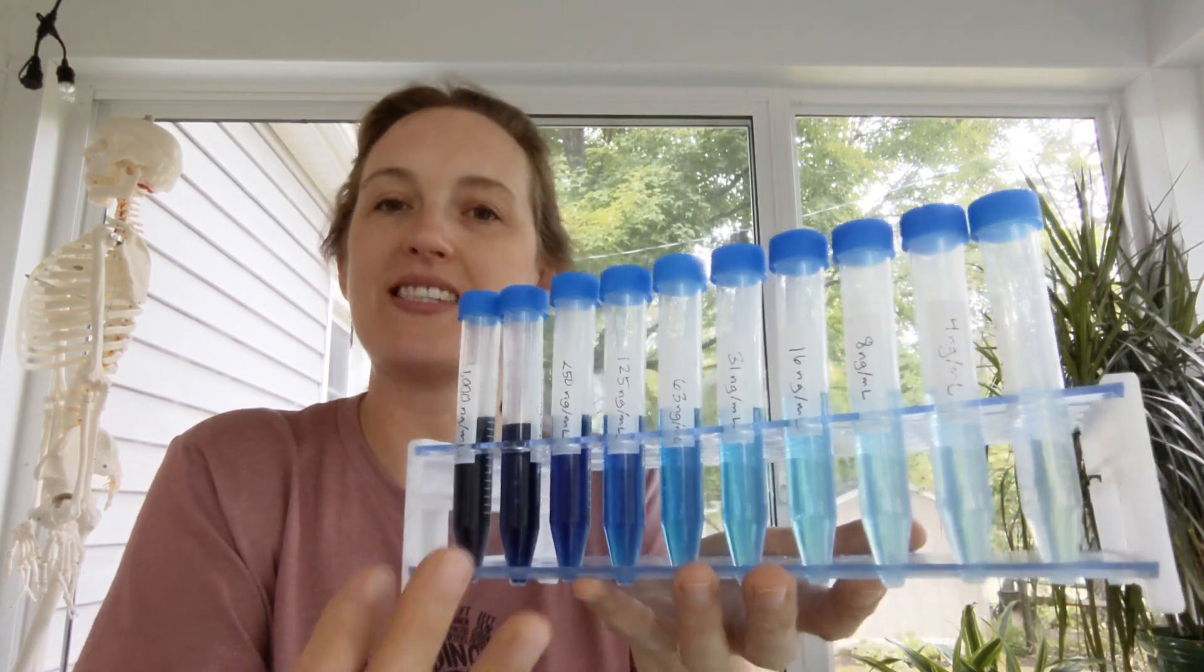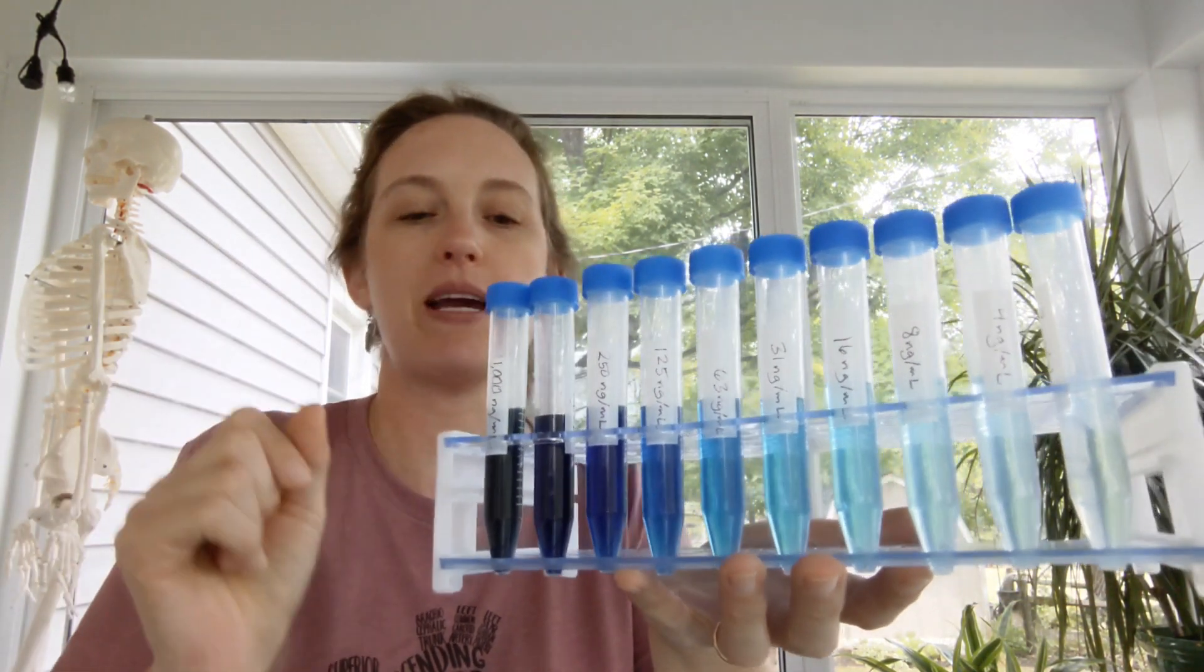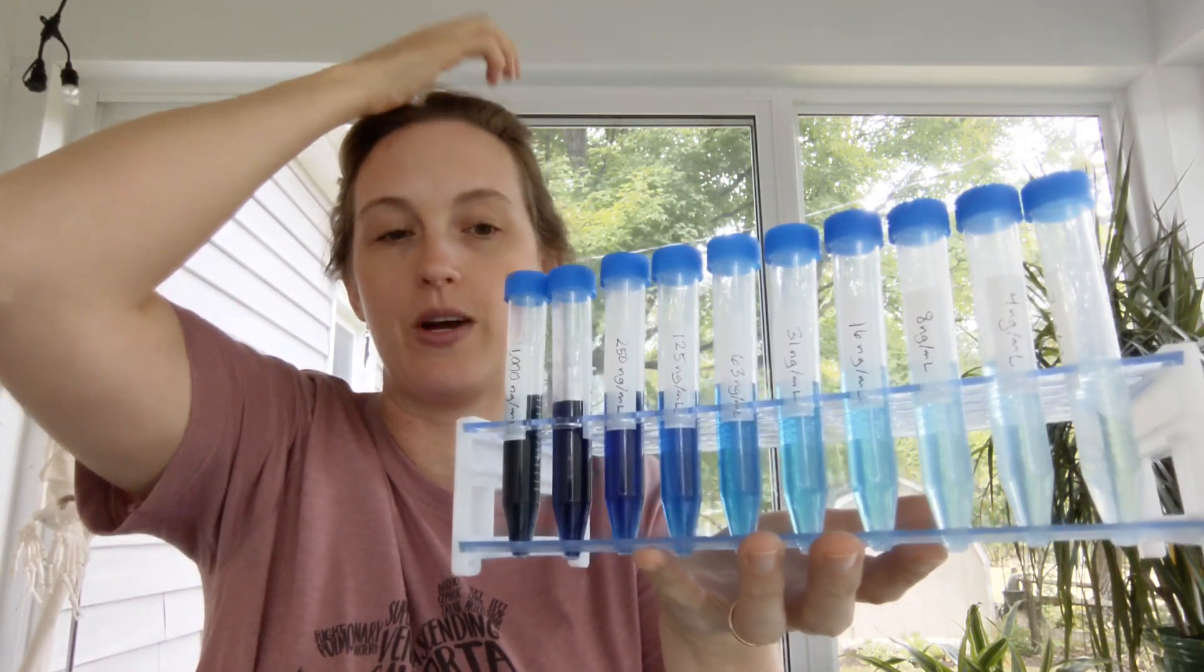So typically in ELISA, the serial dilution is done on a much smaller scale in teeny tiny microtubes, but I've made larger ones just so that we have something to see more visibly and compare to.